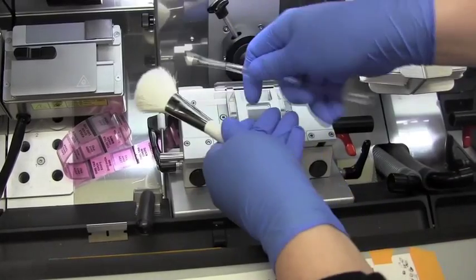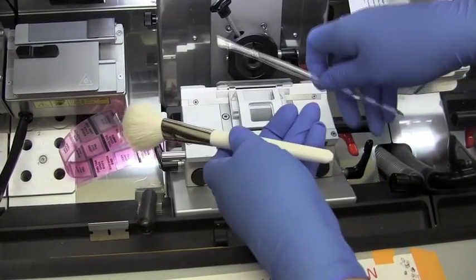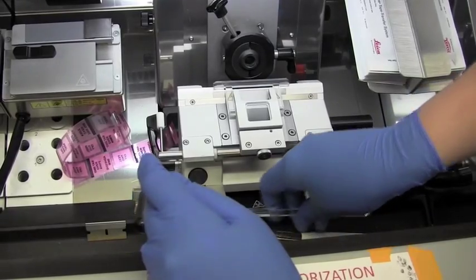And then we have a couple of brushes, and that allows us to clean the blade off or clean the block in between slices.